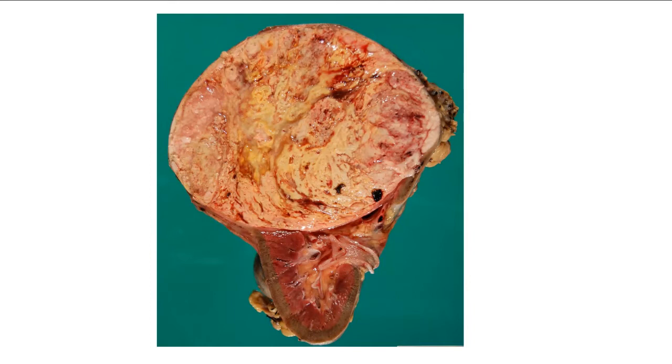Wow. Are we going to put in a container? Okay, I know it's Friday evening, guys. All right, yes, we're going to put in a container. We're not going to put anything other than the specimen in the container. Fabulous. So we're going to put formalin.